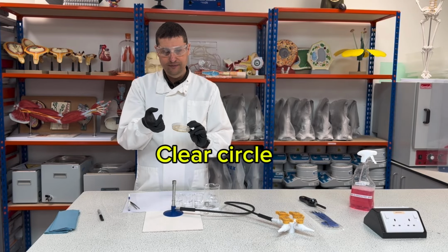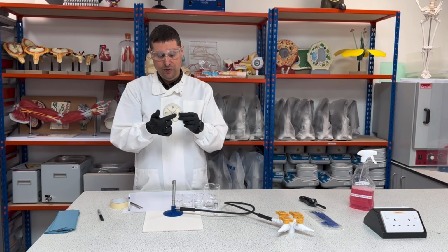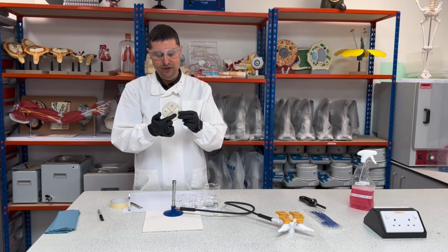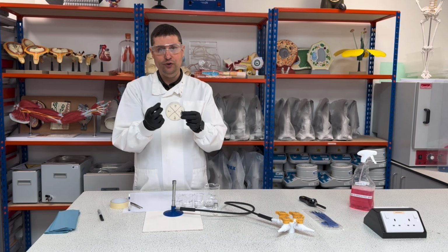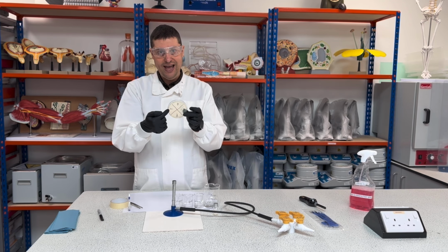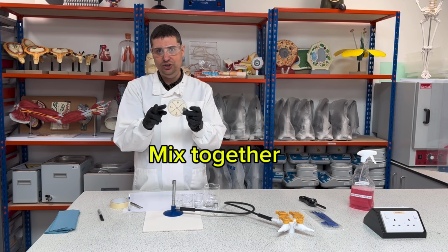One thing very important is where the position is of the disc. The position should be in the middle of my defined area, okay? So this will be easy for you to see. Don't place close to the edge, neither close to the center, otherwise the substances can cross-contaminate each other, okay?